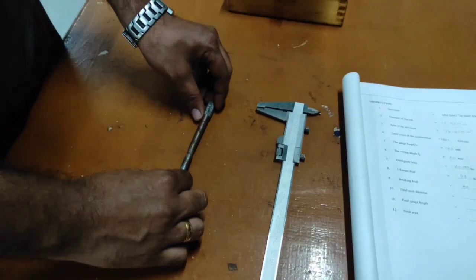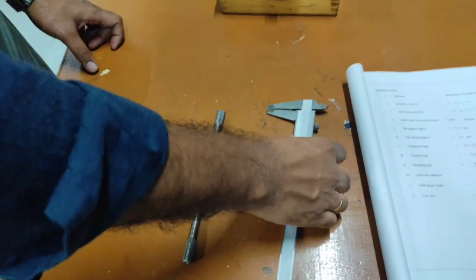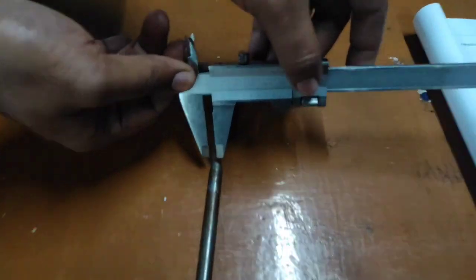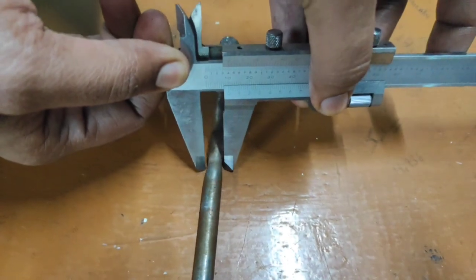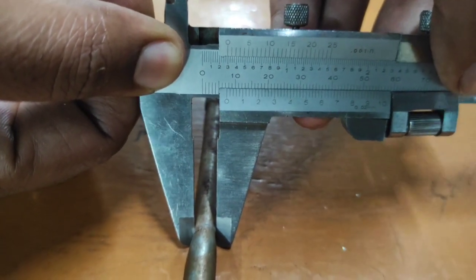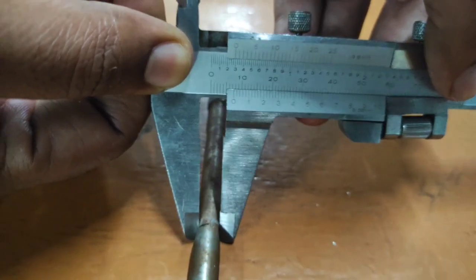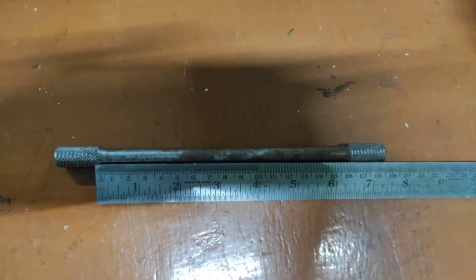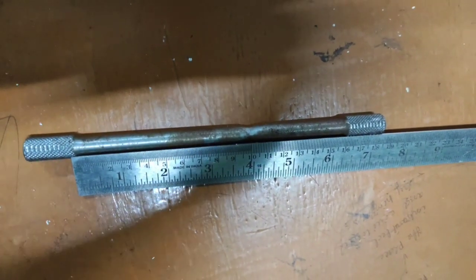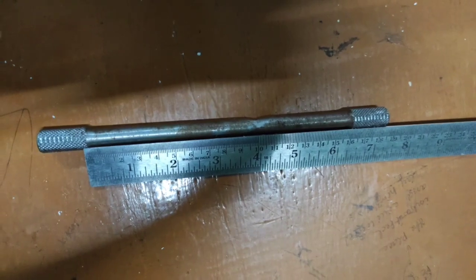Now in order to calculate the breaking strength or breaking stress of a material, we need the neck diameter. So in order to measure the neck diameter, just fix the fractured specimen and make a note of the neck region. The neck diameter can be measured with the help of the vernier. The neck diameter is 7.24, and similarly we have to check the final length of the specimen.